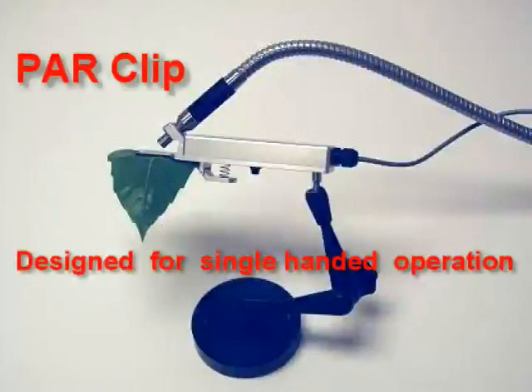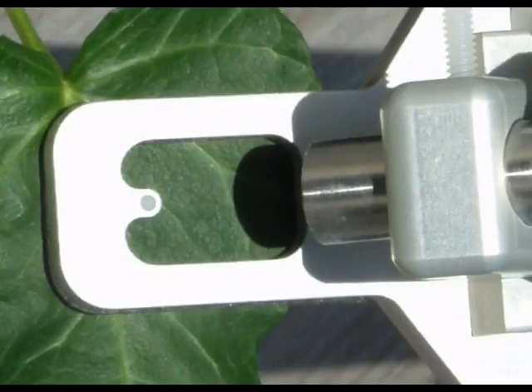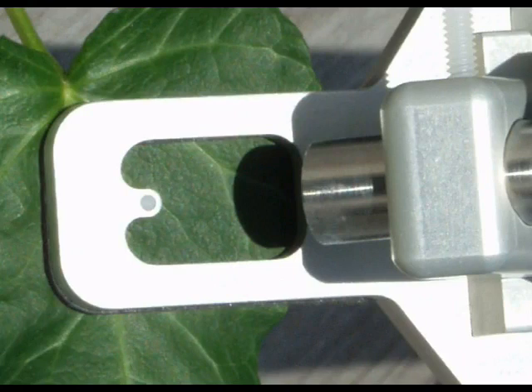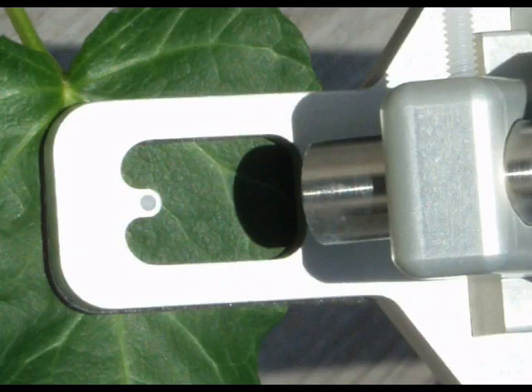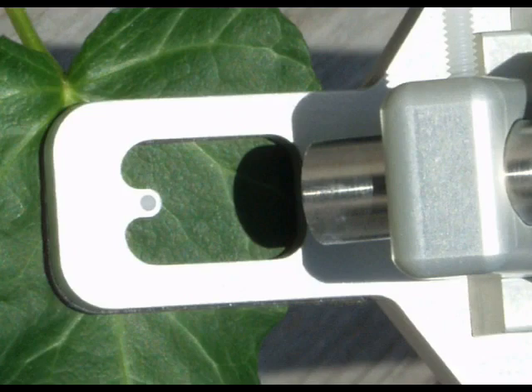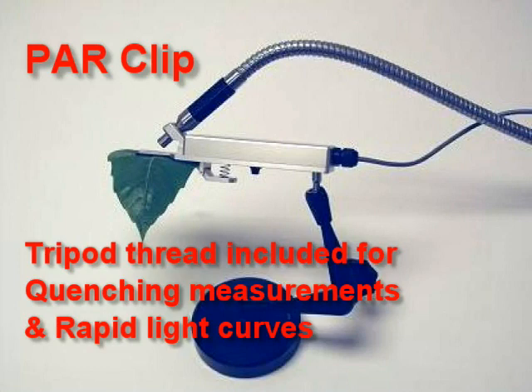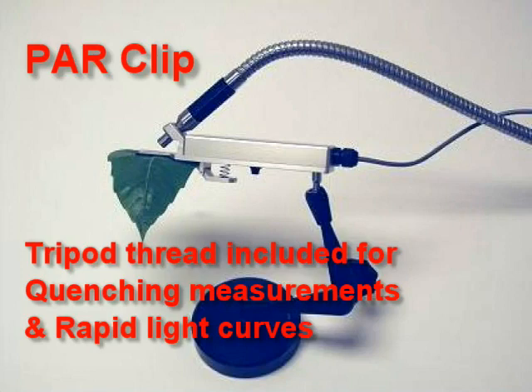For this reason, PARCLIPs are highly recommended for field use. The PARCLIP measures light irradiation at leaf level and leaf angle, along with leaf temperature. Since quantum yield of PS2 is to be measured only at steady-state photosynthesis, it is important not to change the leaf angle when making measurements. The PARCLIP is designed for rugged use and will not accidentally open when used on high leaves or when mounted on a tripod. It is also designed and calibrated to measure either ambient light or internal LED actinic illumination.